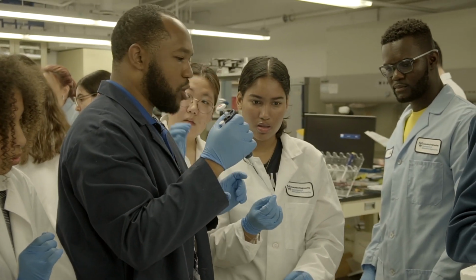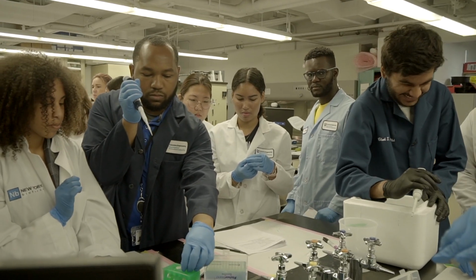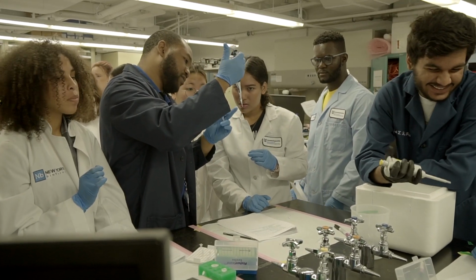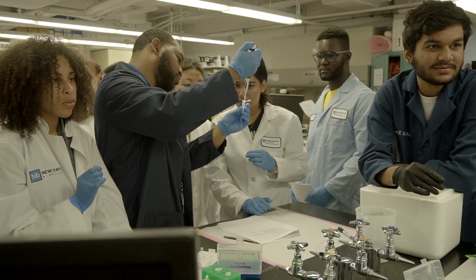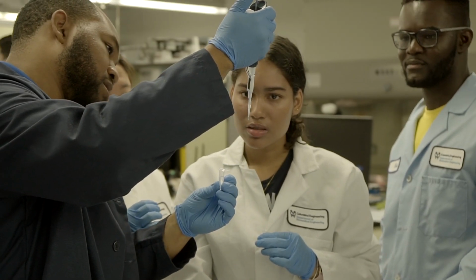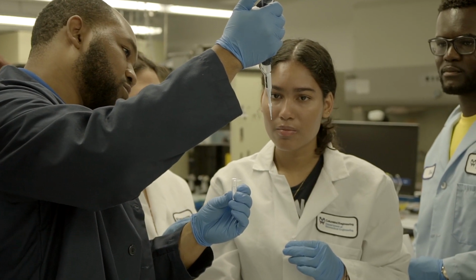Sorry, where's the big thing of water? Over here. So you put it all the way into the water. You have to have really good eyes, but I know from experience this is going to go right to where the line is. Can you see through the tube right now? It's not rocket science. Do you see it? And now it's right at the line. When I'm doing this, I can actually see the line up and down. So just be looking.